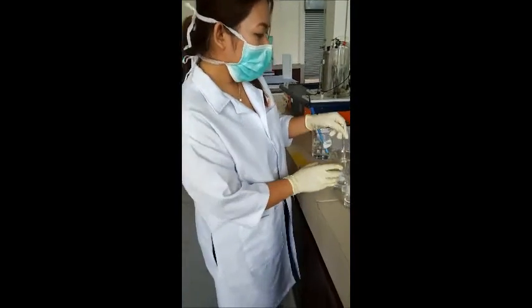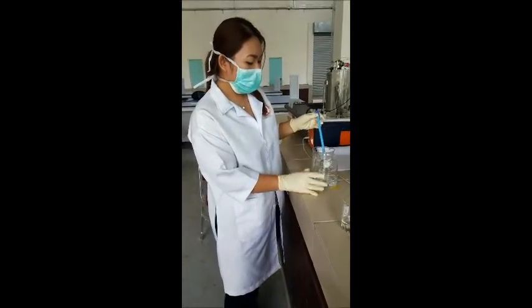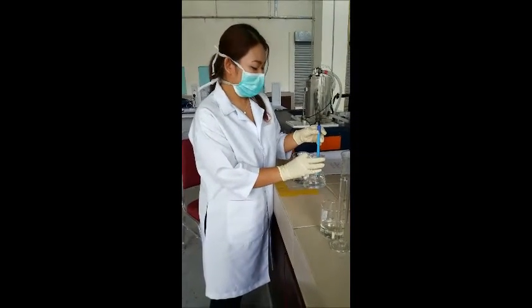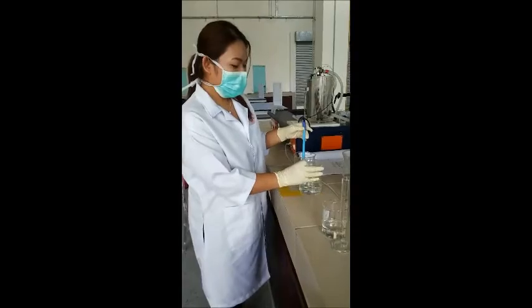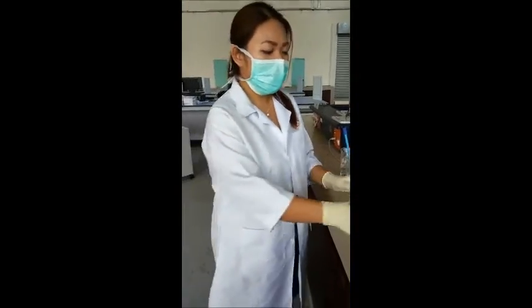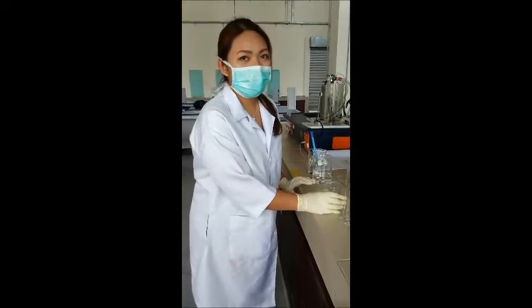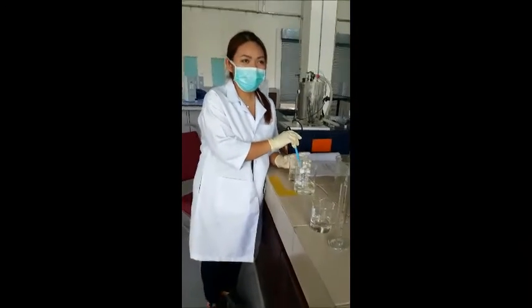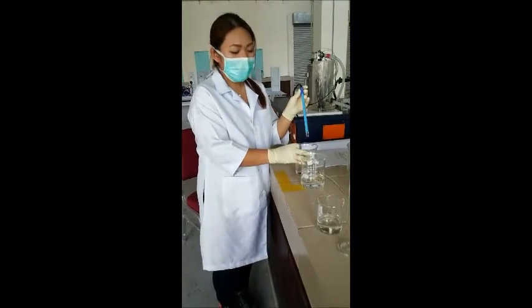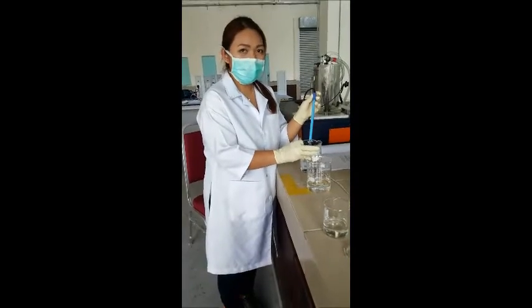After we stir the solution, we measure the conductivity using the conductivity meter. The results are obtained on the desktop of the computer. And then the step is repeated for another 5 ml of acetic acid until the 100 ml is fully used. After we measure the conductivity using the conductivity meter, we need to insert it into the distilled water in order to flush the conductivity meter.